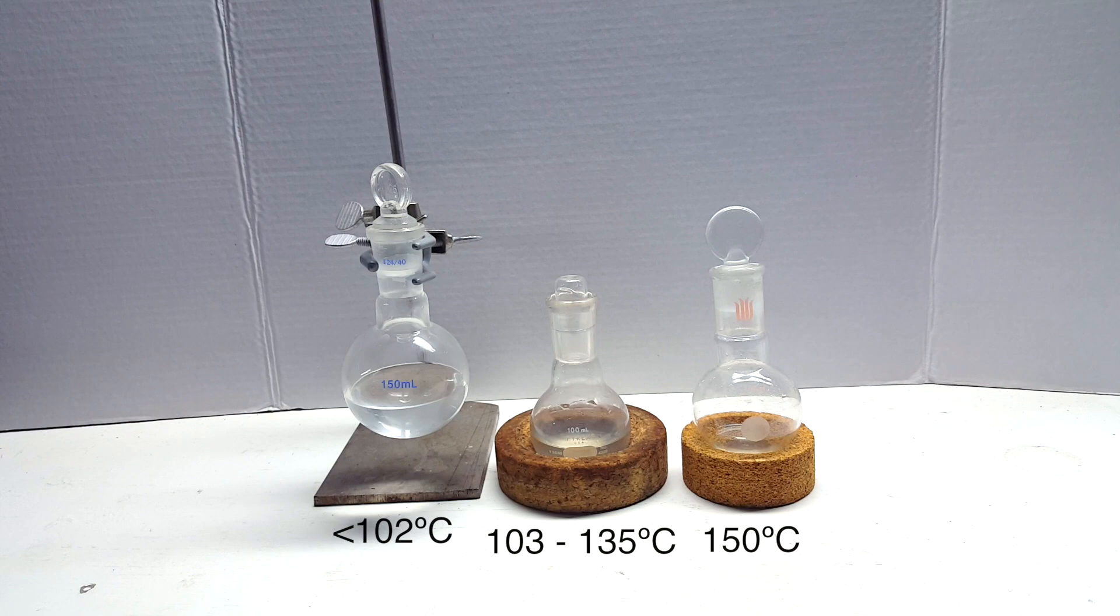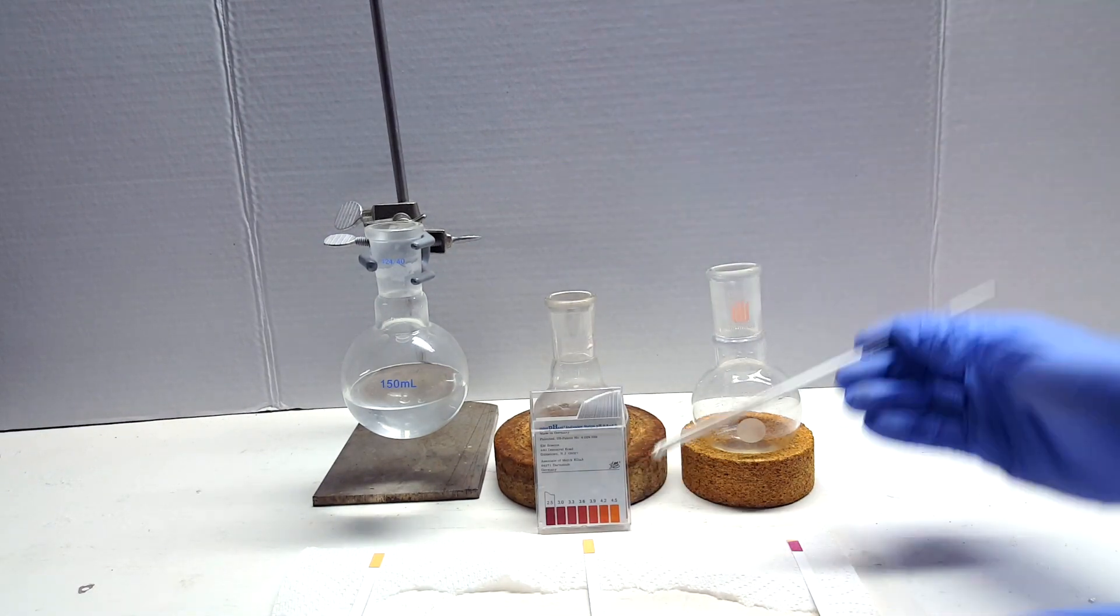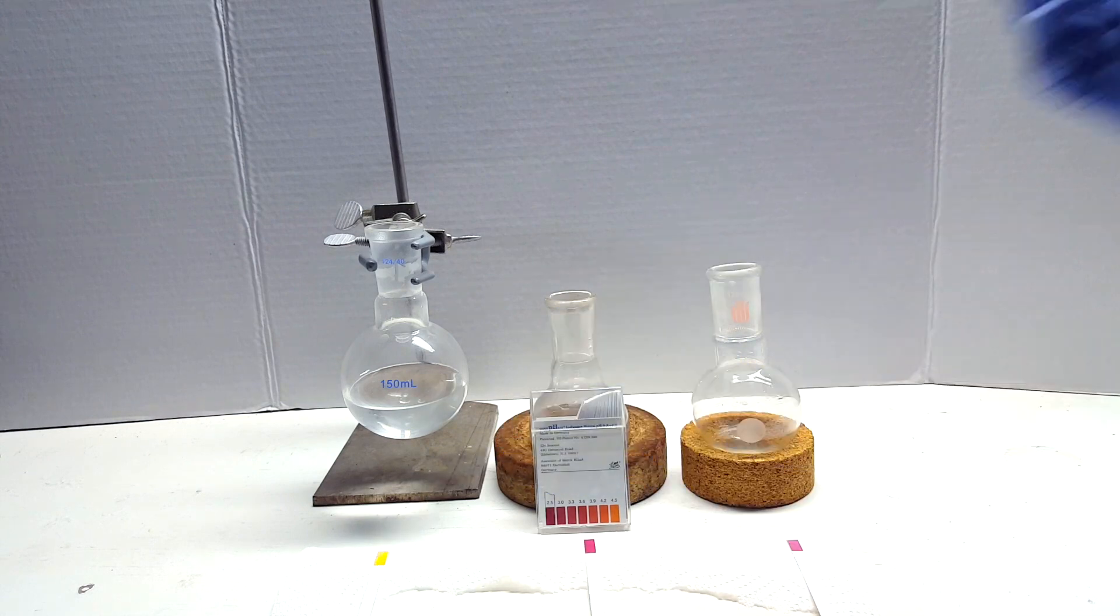A pH test showed that the latter two runs produced very acidic solutions, while the former had a neutral pH. This means the first contains only water, but the second two runs contain phosphoric acid.